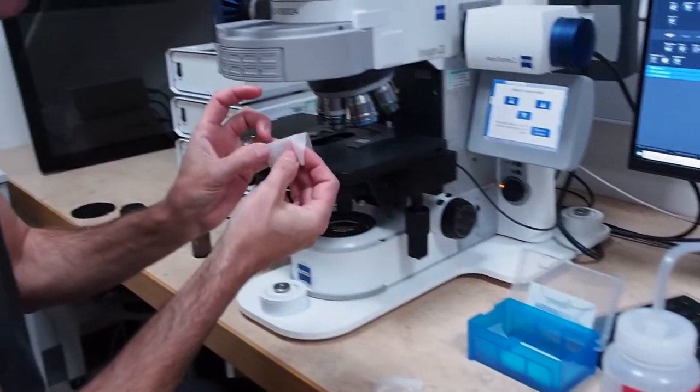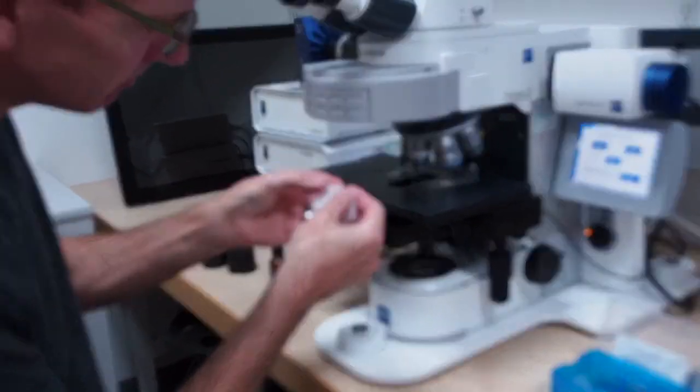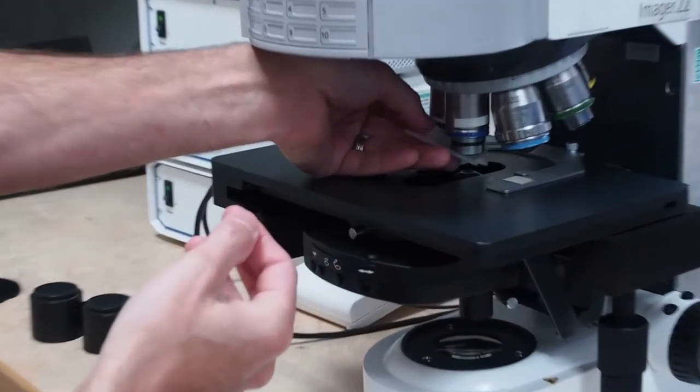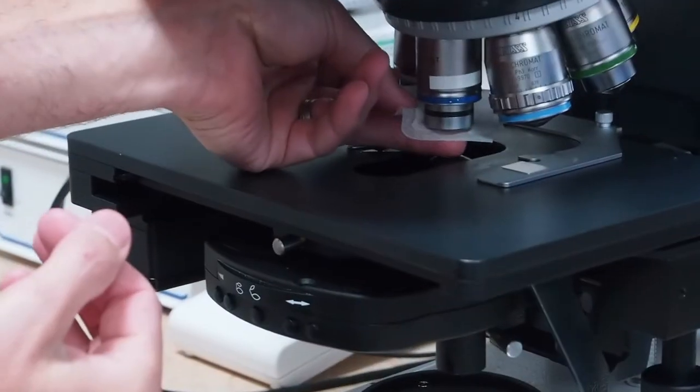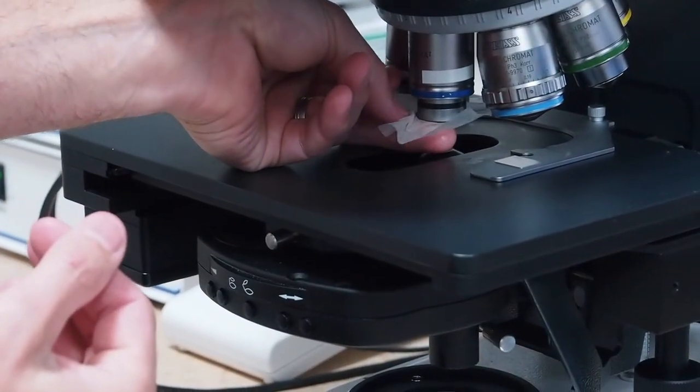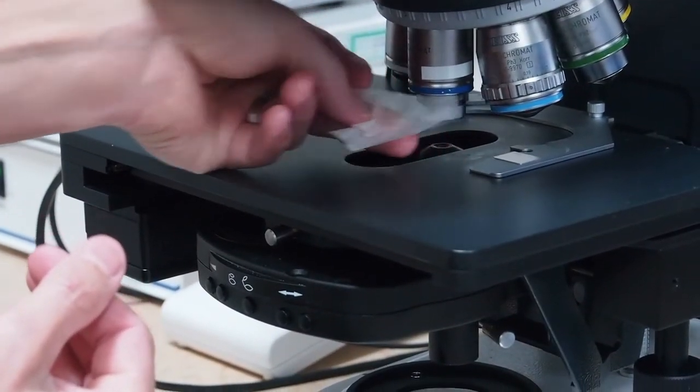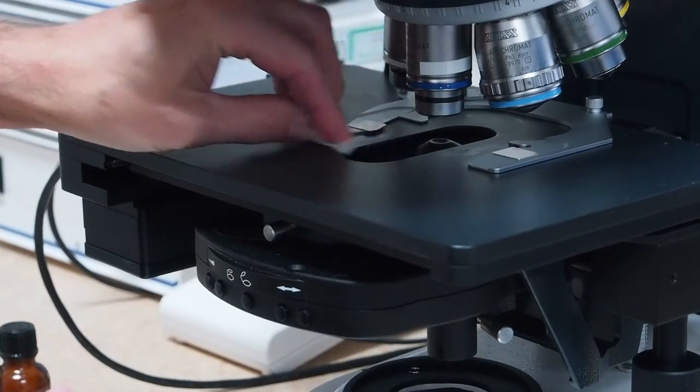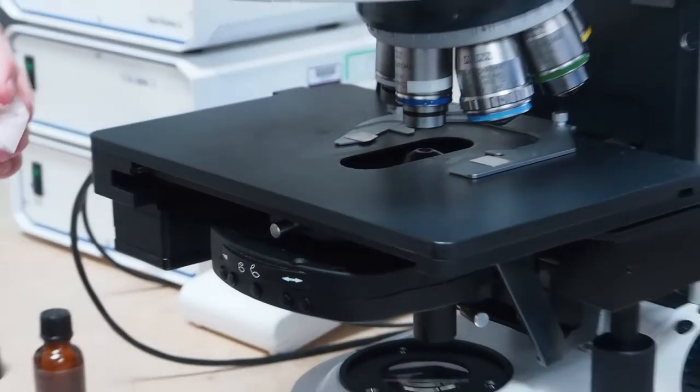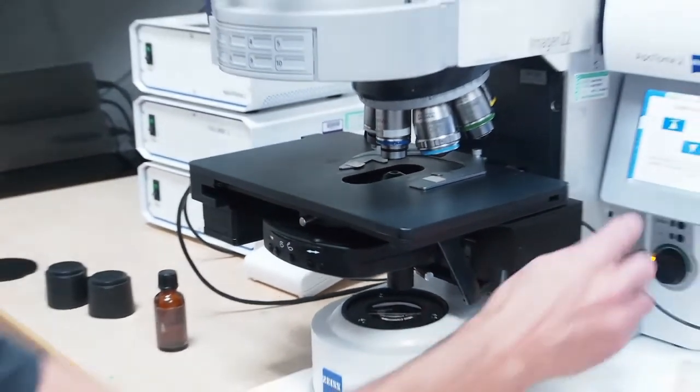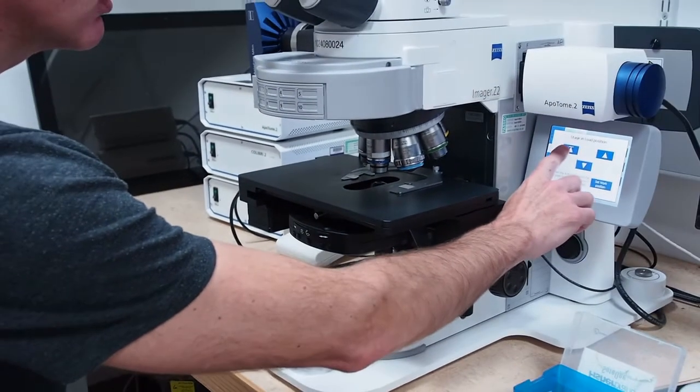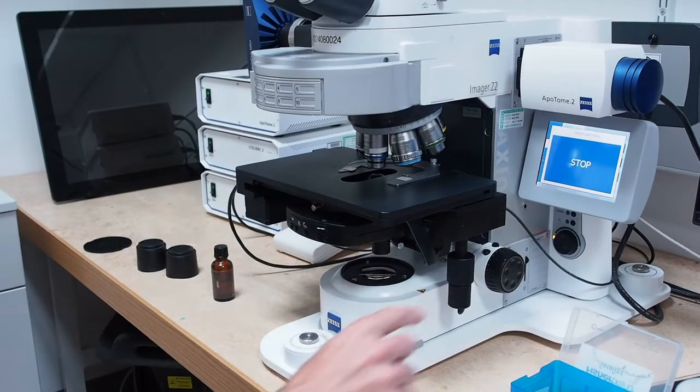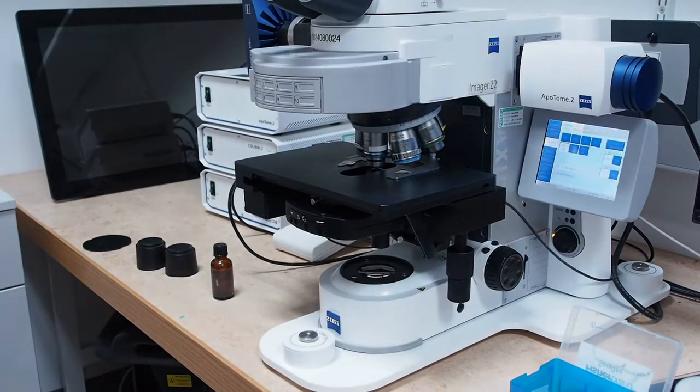Finally, take a clean dry piece of lens tissue, fold it in half and wipe the lens to remove any alcohol residue. Lastly, wipe any spillages from the microscope stage. Click the left hand up arrow on the touch screen to move the stage back to the working position.